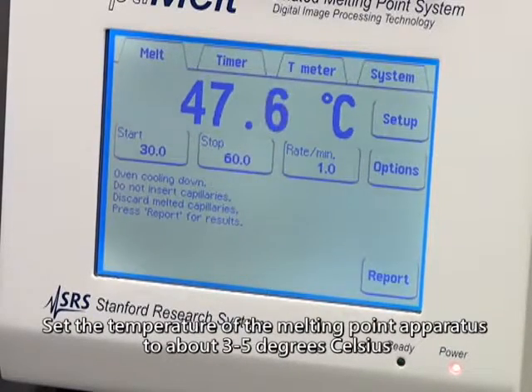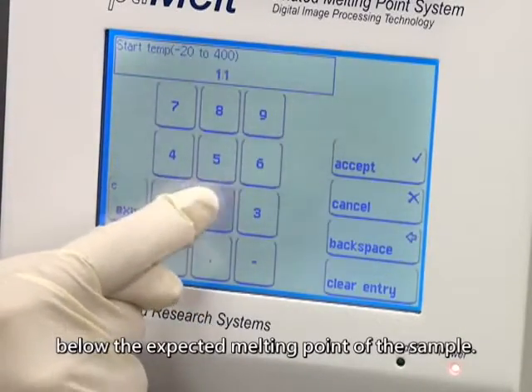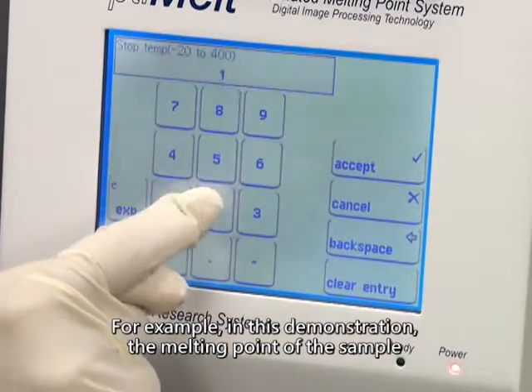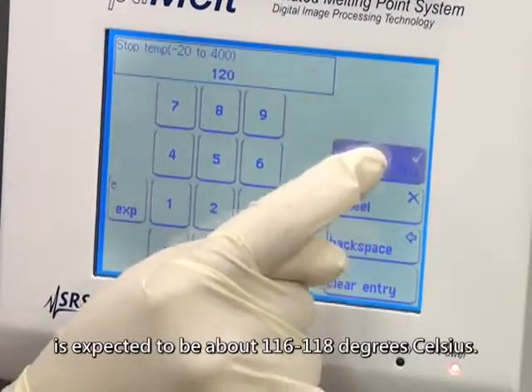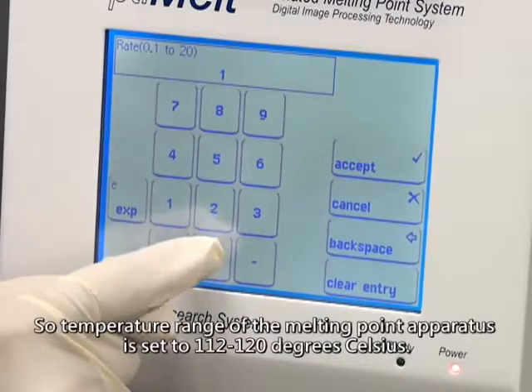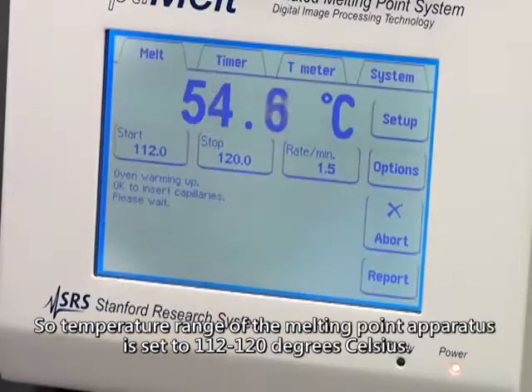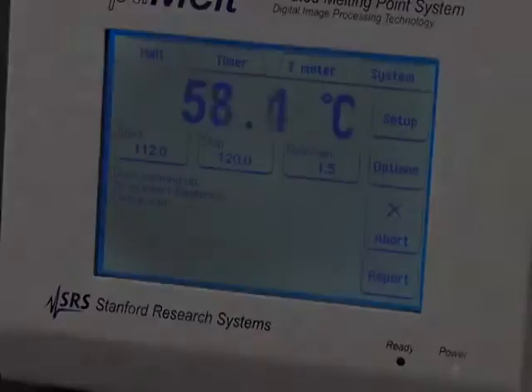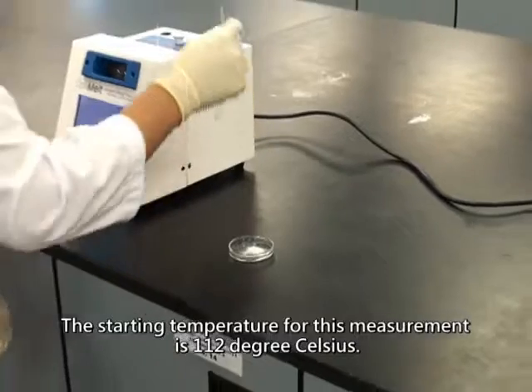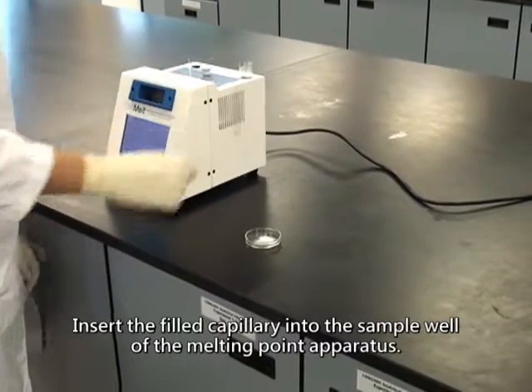Set the temperature of the melting point apparatus to about 3 to 5 degrees Celsius below the expected melting point of the sample. For example, in this demonstration, the melting point of the sample is expected to be about 116 to 118 degrees Celsius. So the temperature range of the melting point apparatus is set to 112 to 120 degrees Celsius. The starting temperature for this measurement is 112 degrees Celsius. Insert the filled capillary into the sample well of the melting point apparatus.